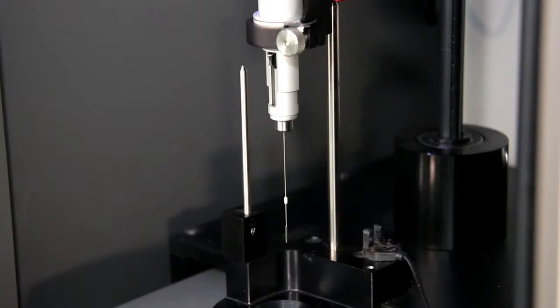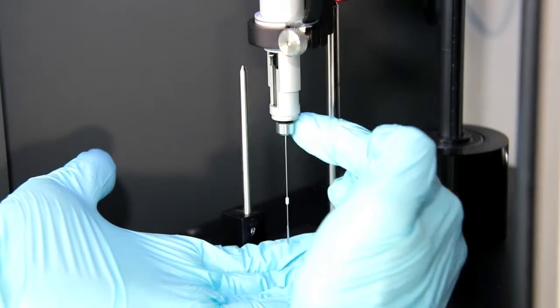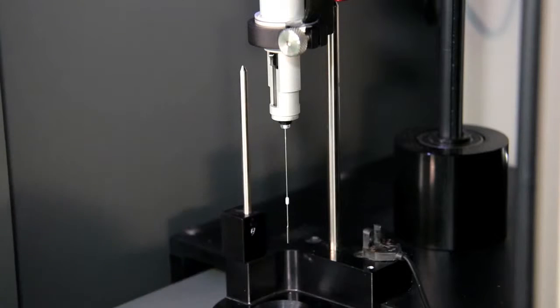Once the pipette is in position, the first step is to loosen and remove the securing nut, being mindful not to drop it in the cell. You may set this aside.